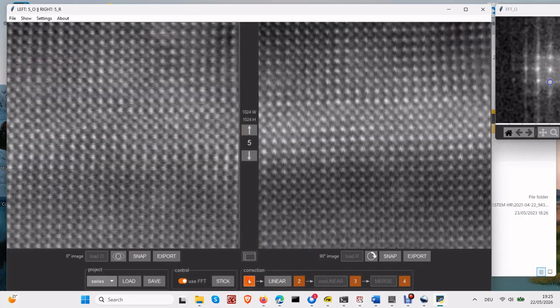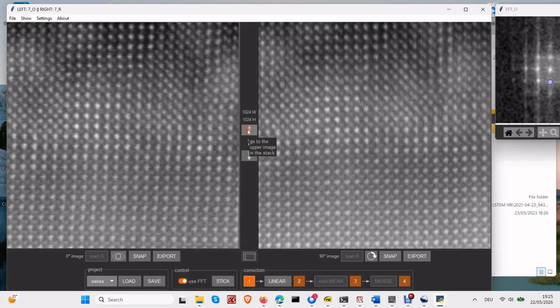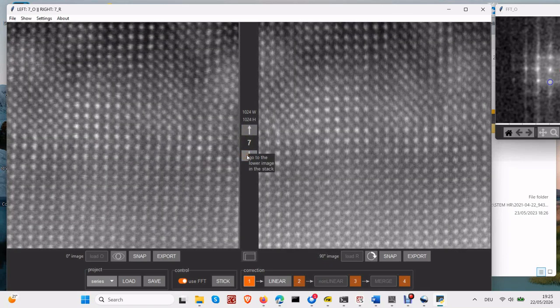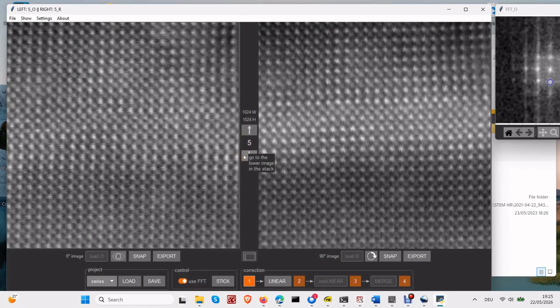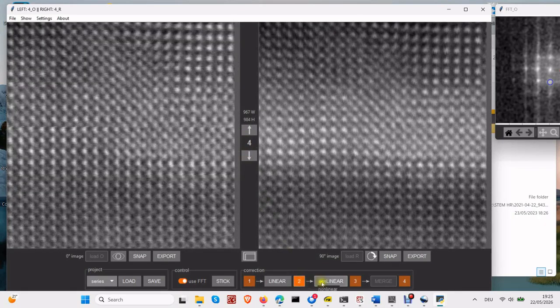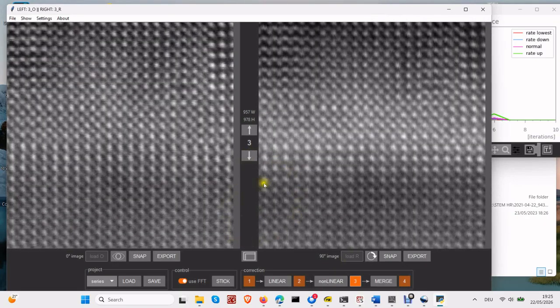You might question why we don't proceed all images with one button click. Well, we considered that, but for the moment, it seems that a user should have more flexibility as each pair could be treated differently, either with cross-correlation, FFT, or sticking points. That might be changed in the new versions. For the moment, just scroll among the pairs and click the Processing buttons.